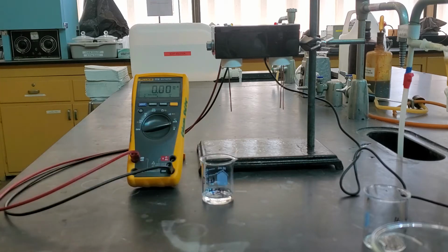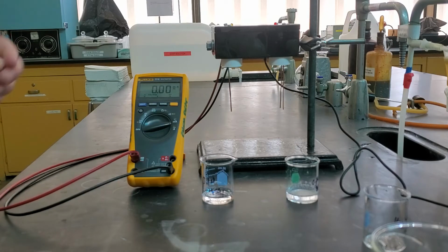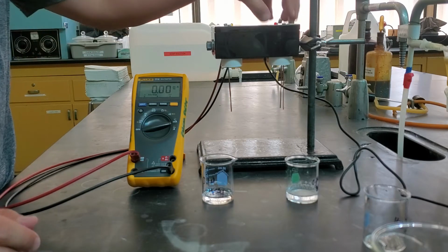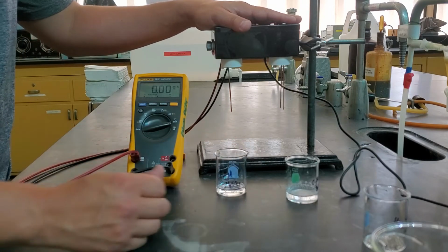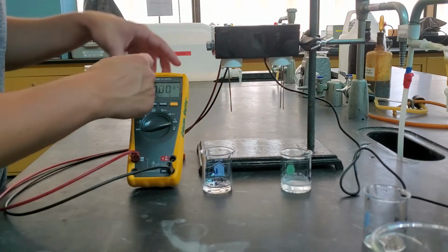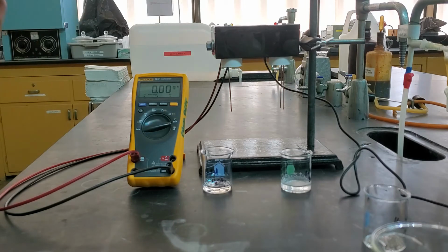When we mix them together, then we're seeing what that new mixture is. And since we have the same solution on each, basically half is coming from one beaker, half is coming from the other. So they're about the same. And so you can think of them as being our first set of experiments when we're doing them like this in their pure solutions. We're measuring this one separately, we're measuring this one separately, and then this value that we get is them being added together. Once we mix them, then we're measuring just that solution.